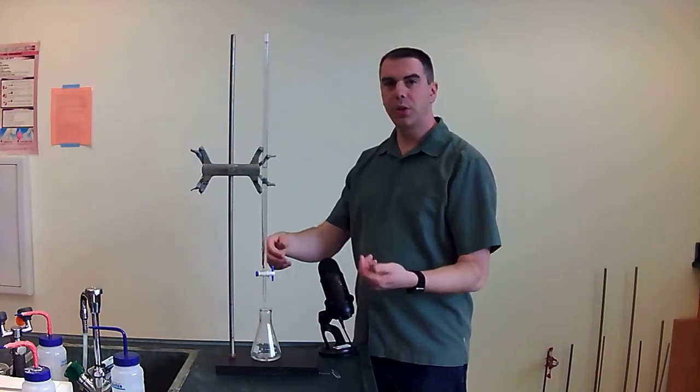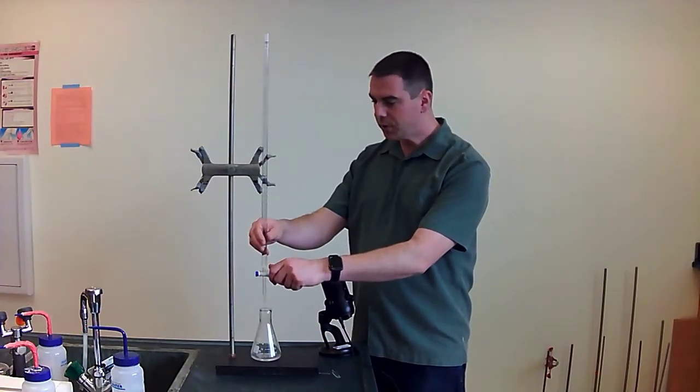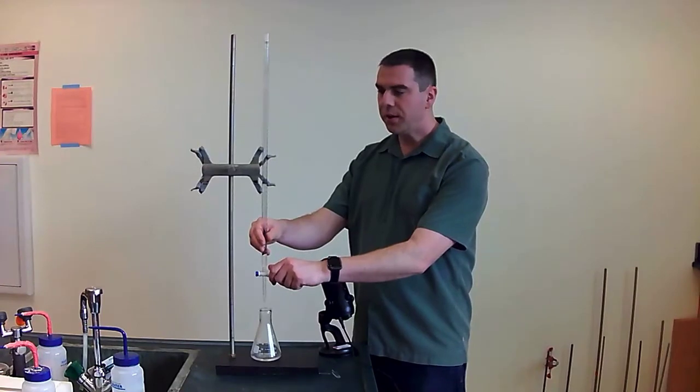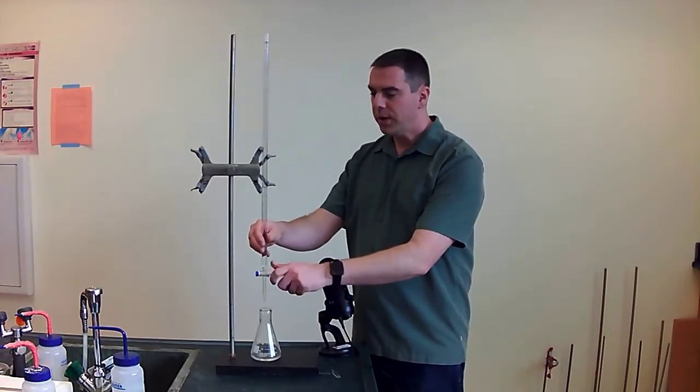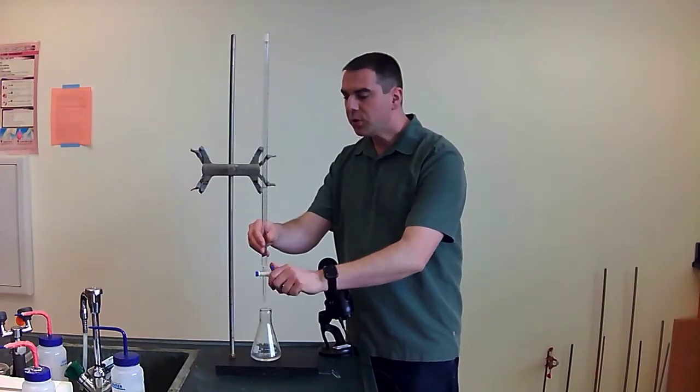And then as you get a little closer to the end, you're going to slow down. And then as you get really close to the end, you'll start going drop by drop. So you can do that by twisting this, you go drop by drop, and then suddenly, oh great, my reaction is done.